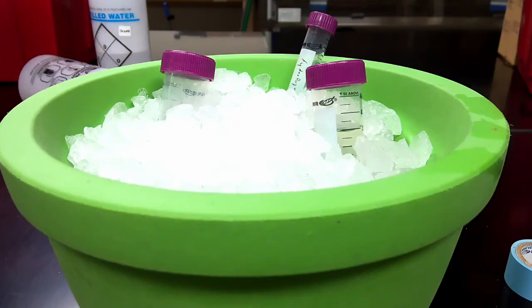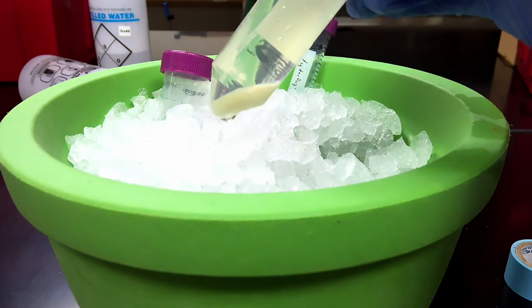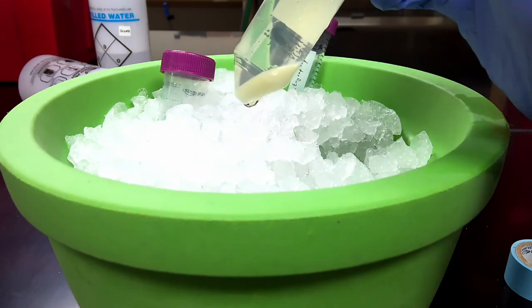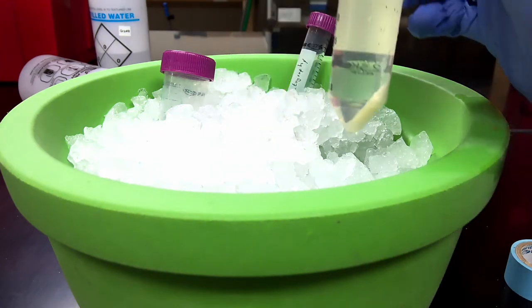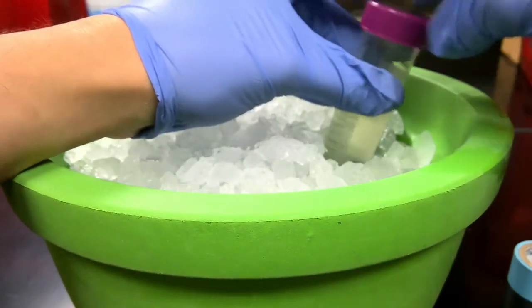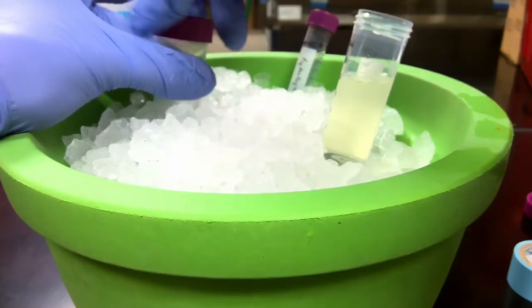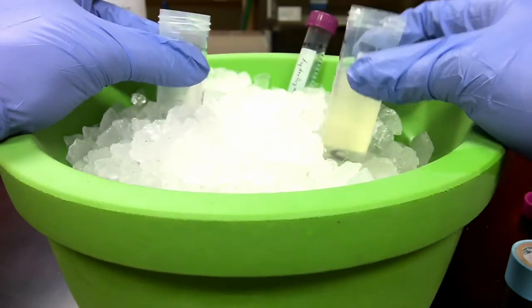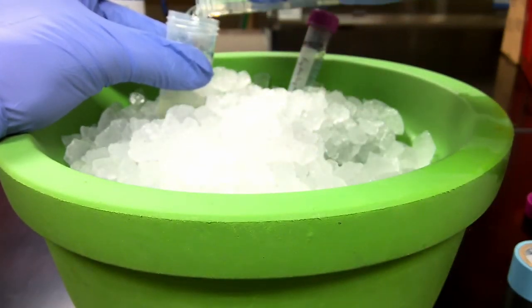All right, everyone. We've now finished up with the last centrifugation. As you can see, we got a really large pellet. This pellet that you see here is all of the proteins that were made in the BL21 cells. So the last thing we need to do is resuspend this pellet, aliquot it, and store it, so that sometime in the future we can try purifying our actual protein from all the junk protein that's also in this pellet.